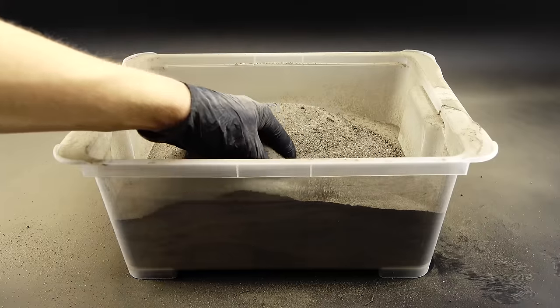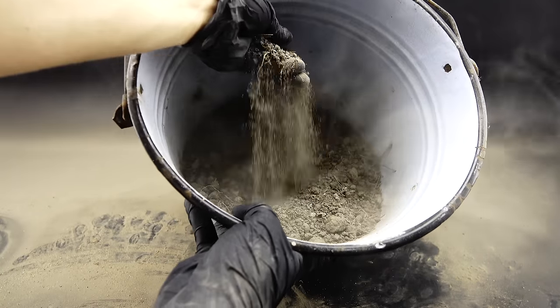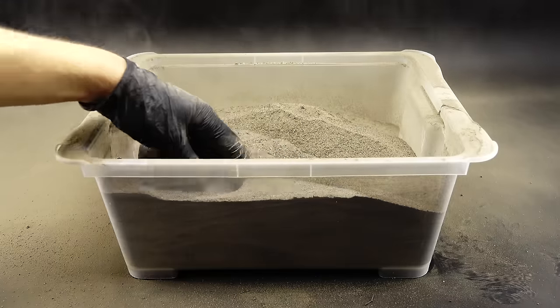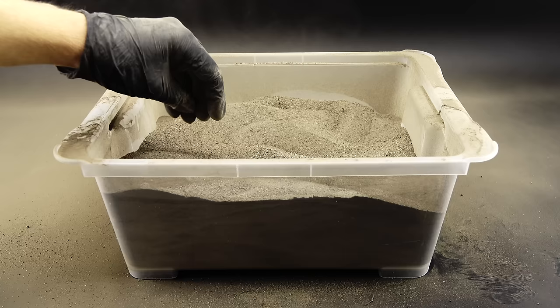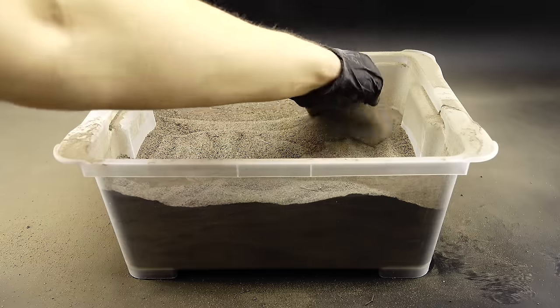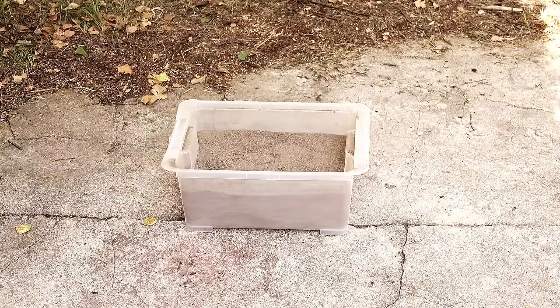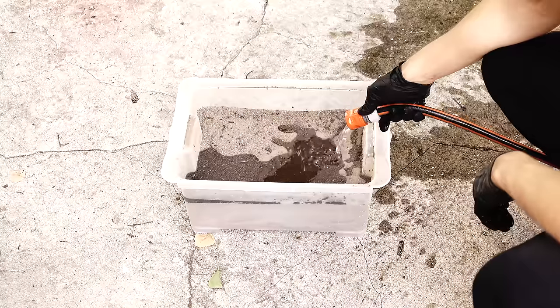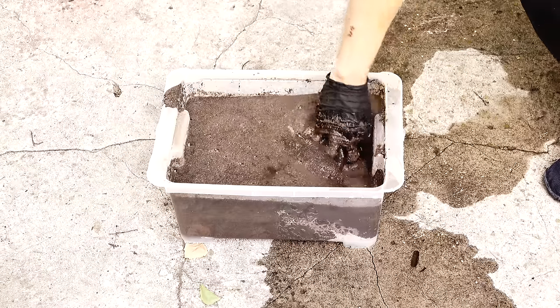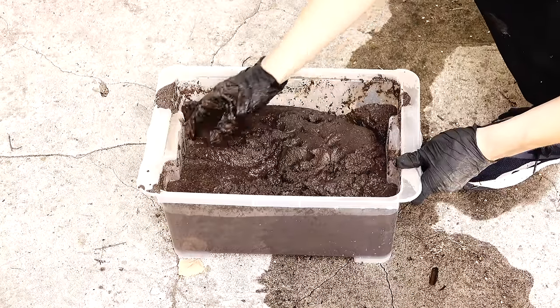When I was done using the sieve, I was left with a plastic container full of some pure laboratory dirt, and about half a bucket worth of unidentified dirt contaminants. I now have to remove all the contaminants stuck to my precious sand, and the best way to do that is to wash everything with a ton of water. This unfortunately won't be 100% efficient, but it's just an initial cleaning step serving to ease the real purification later. I got the purified dirt container outside to the place of doom where all the messy experiments take place, and started to wash it using a garden hose. The dry dirt had a really hard time getting wet, and when it finally did, I realized I just synthesized some real nice mud, which gave me flashbacks of my early childhood.